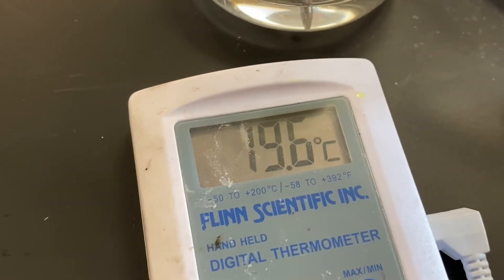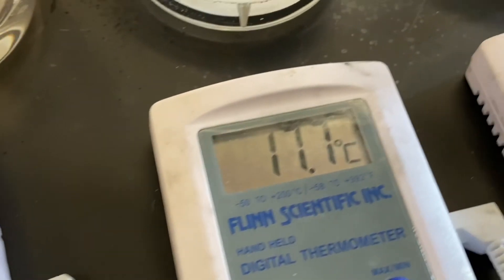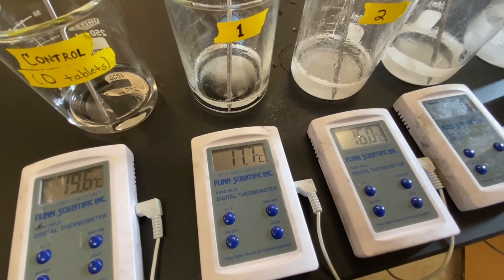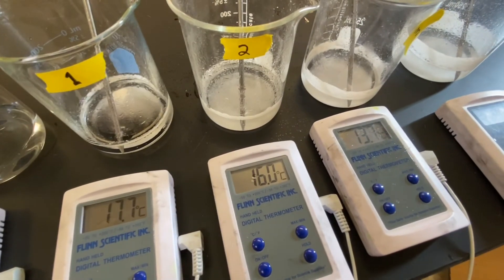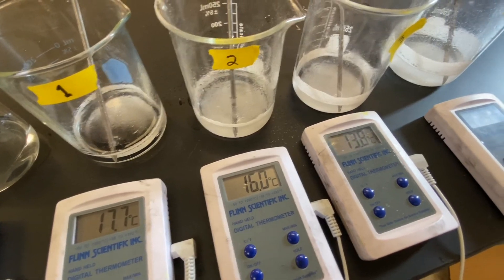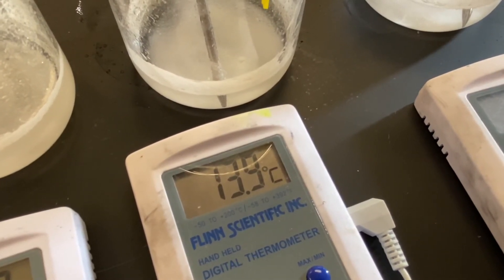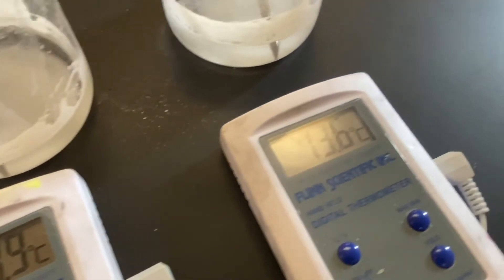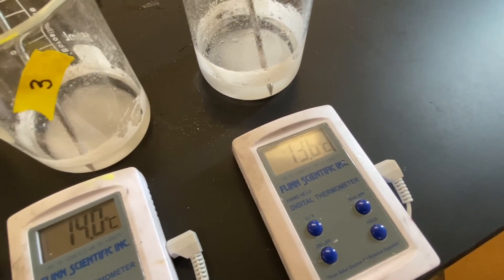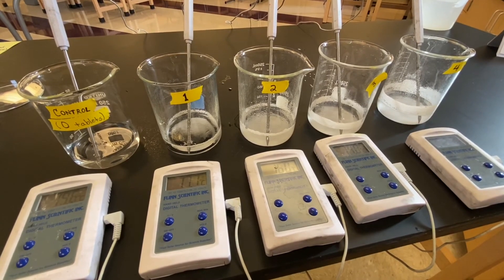On our control, the temperature is 19.6 degrees Celsius — final temp for beaker zero. Beaker one: 17.7 degrees Celsius. Final temp for beaker two: 16.0 degrees Celsius. Final temp for beaker three: 13.8 degrees Celsius — it's starting to come back up slightly. And 13.6 degrees Celsius is the temperature for beaker four. Make sure that you get those recorded in your data chart.